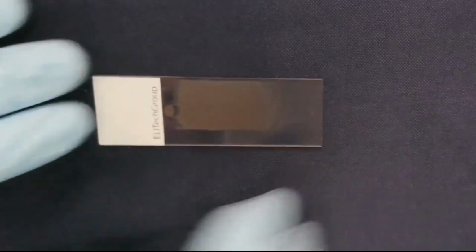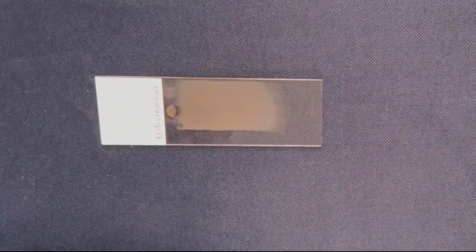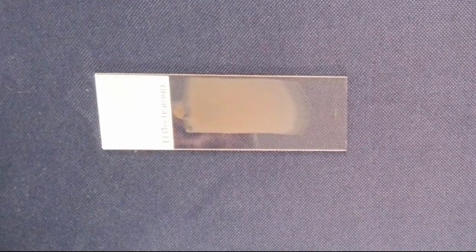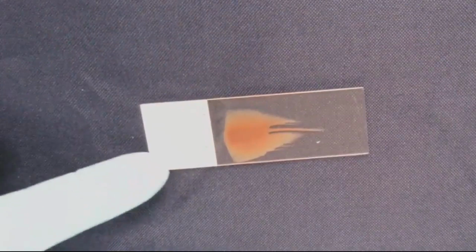This slide shows a much improved monolayer. It is seen at the end of the feathered edge just before it becomes translucent. Overall, the thickness and consistency are much better. The issue here is that nearly half of the slide on the bottom is missing entirely. This is most likely due to not allowing the blood to wick evenly across the slide in both directions before pushing it across.